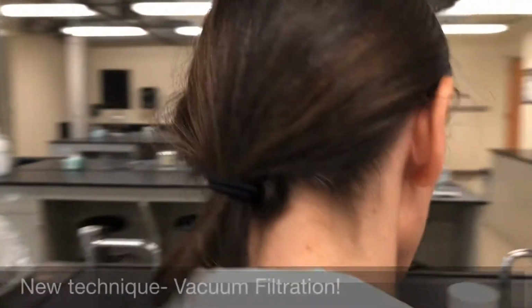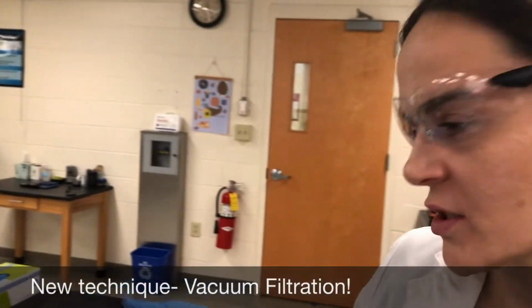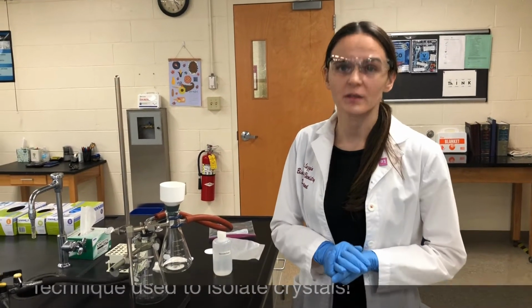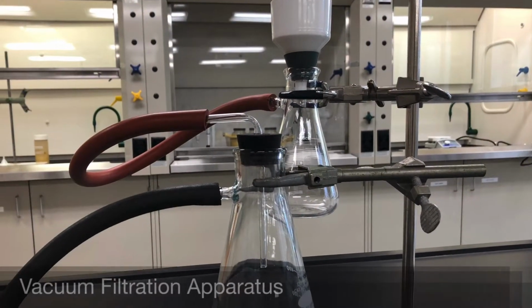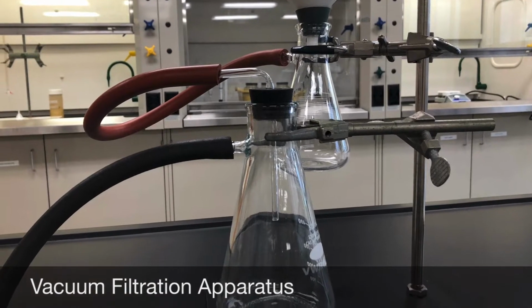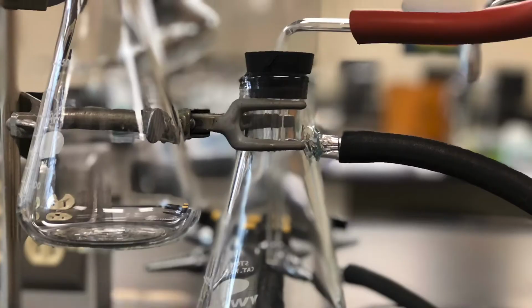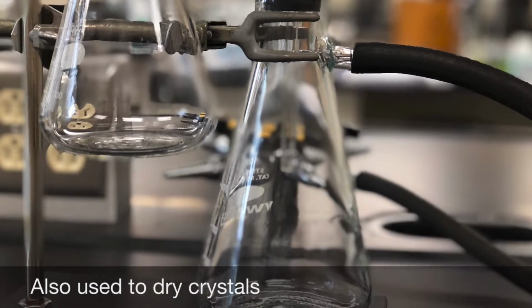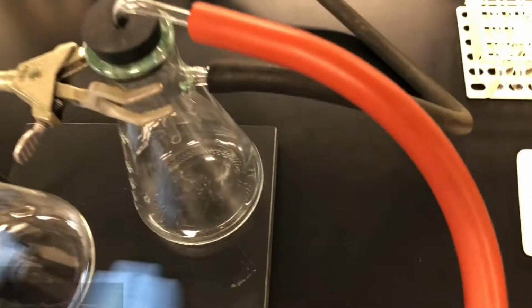I want to show you vacuum filtration technique. So the vacuum filtration technique is another way we can use to isolate the crystals, so to separate the solid from the liquid. A ring stand, all right.